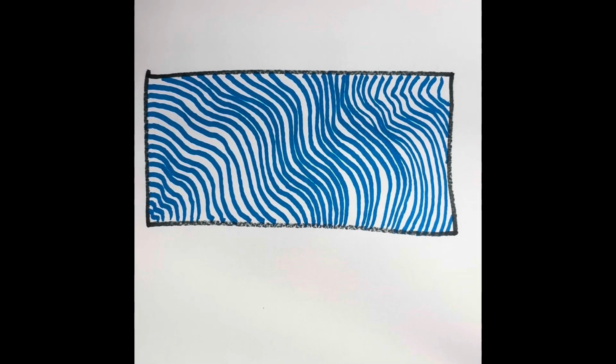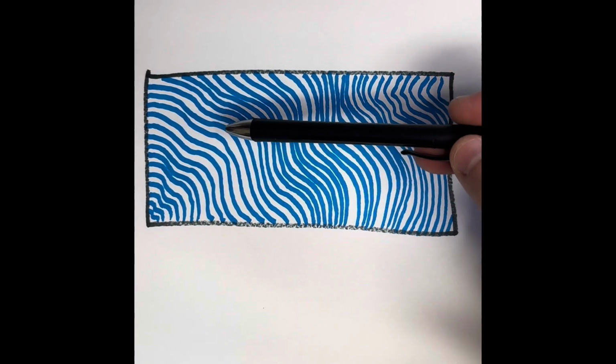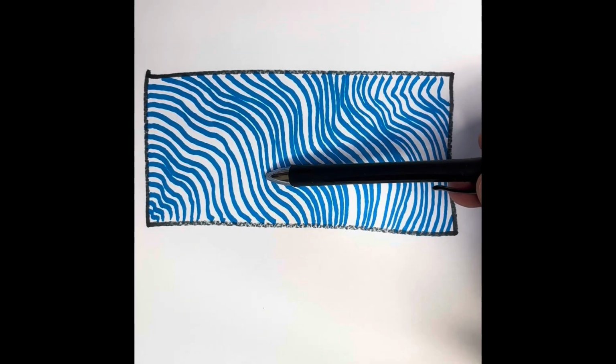This is another fibrous connective tissue. This is dense regular. It's tightly packed and has an organized wavy pattern to it. This actually makes it easier to see the fibers. The fibers themselves are made up of collagen and elastic.